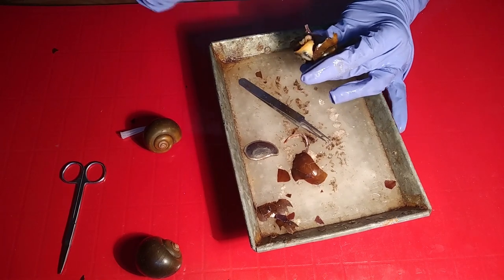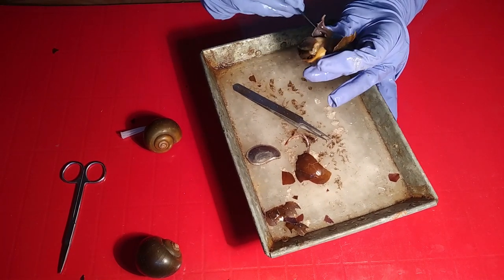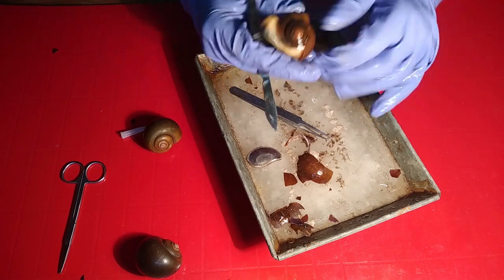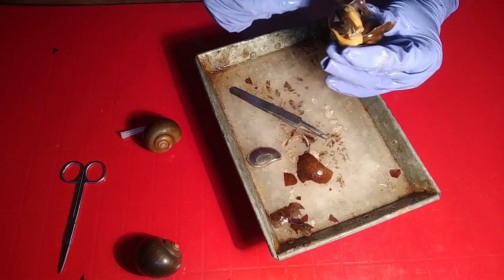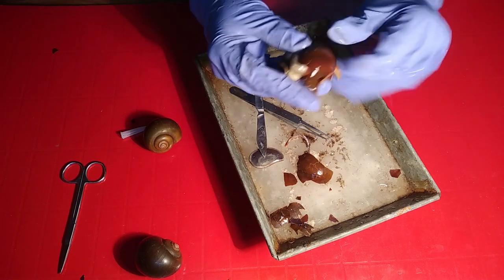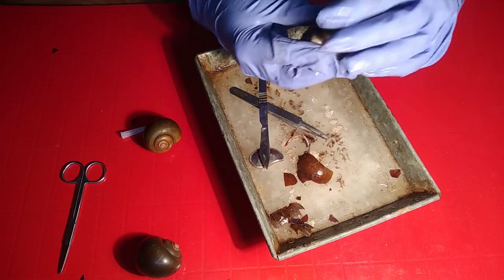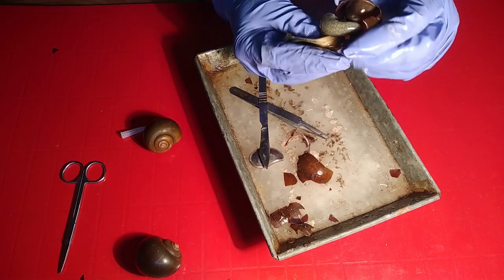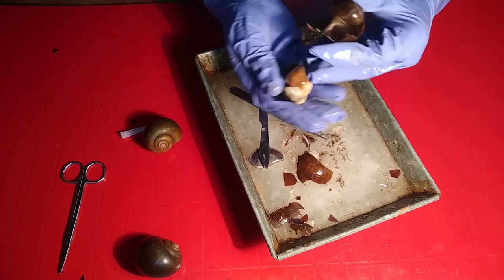Yes, yes, it's coming out, coming out! Now coiling in anti-clockwise mode. Wow, that's the effect of torsion — look at the effect of torsion, the coiling patterns!